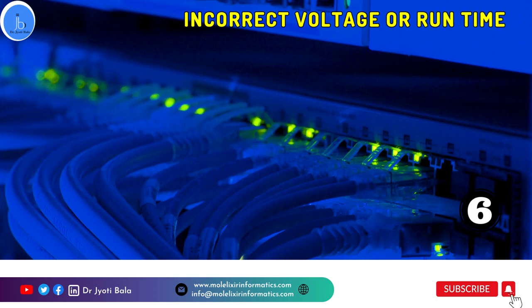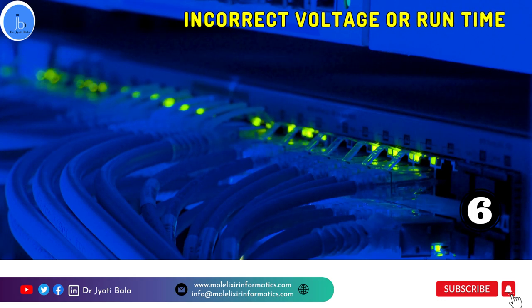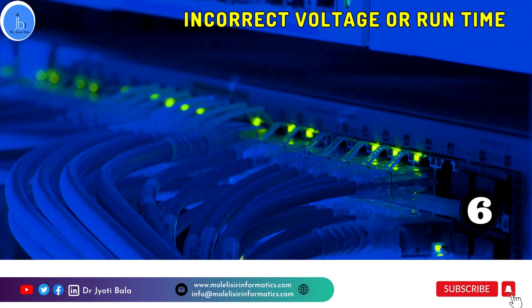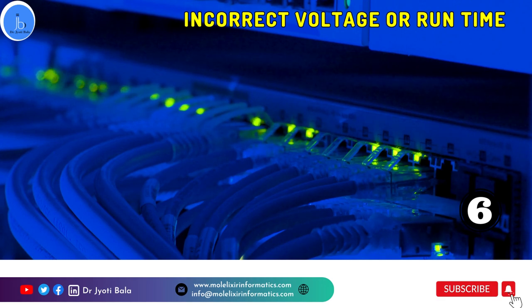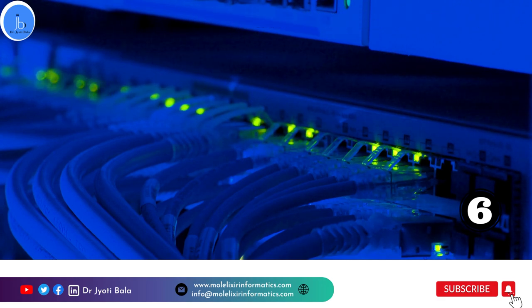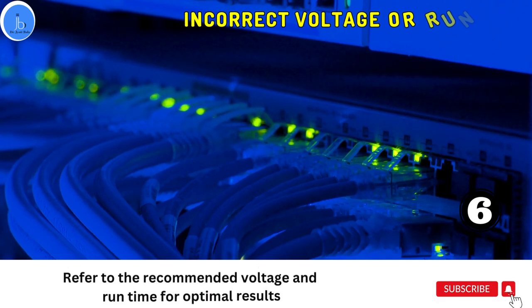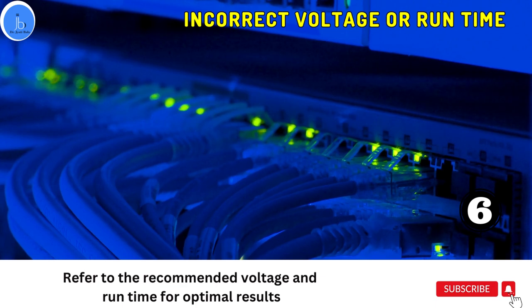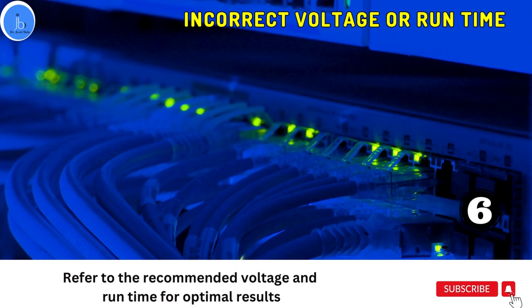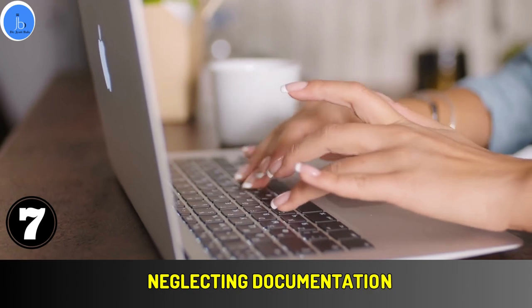The next mistake is incorrect voltage or run time. Using incorrect voltage or running the gel for inadequate time can affect the resolution and separation of protein. Refer to the recommended voltage and run time for optimal results.